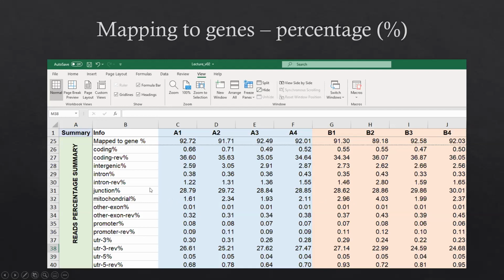And also, this is the junction percentage. If you are going to do alternative splicing analysis based on RNA-seq, the number of reads in the junction, or the junction percentage, is very important. It will give you more information about the splicing.